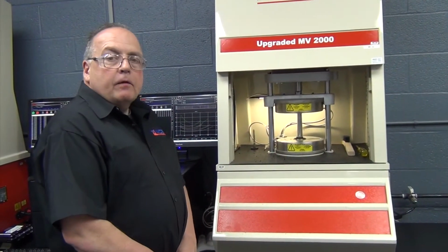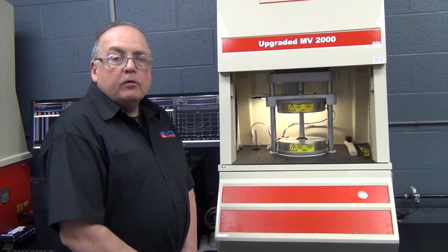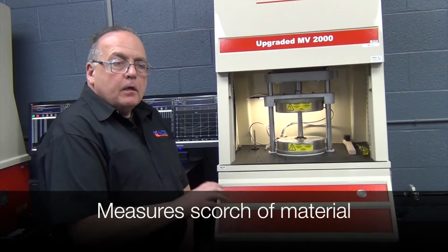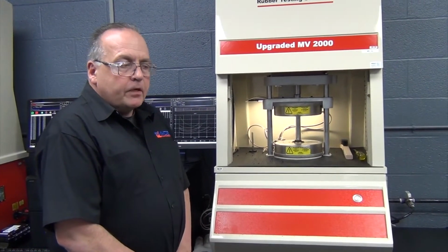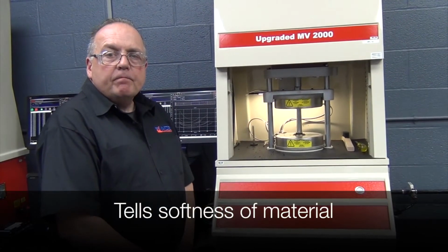Okay, I'm standing in front of the MV2000 Mooney Viscometer. We can do two tests with this machine. We can do a Mooney Scorch, which will measure the scorch of the material, to see if it's going to be a good material for extruding. The next test we do is a Mooney Viscosity. This tells you the softness of the material.